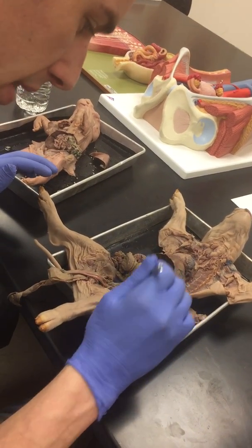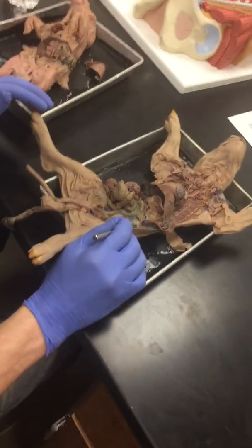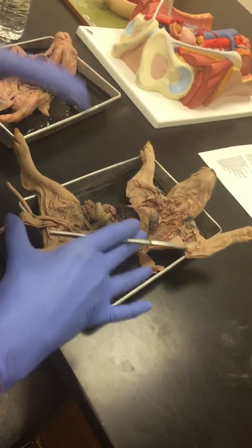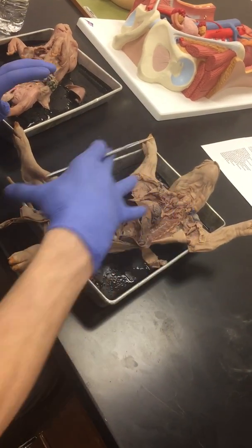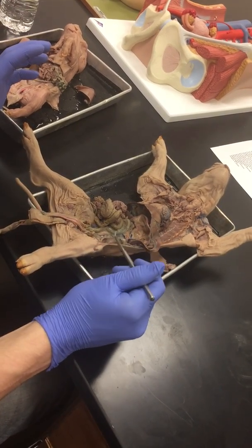Coming back up, missed some things. We're going to have the peritoneum, which is covering the kidney here. So they can ask for the peritoneum, and really the peritoneum is a membrane that goes all the way around. So if they're asking for a membrane down here in the abdominal area, it's going to be the peritoneum. So the peritoneum covers the kidneys.